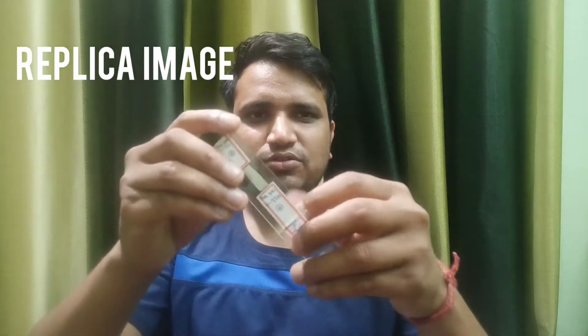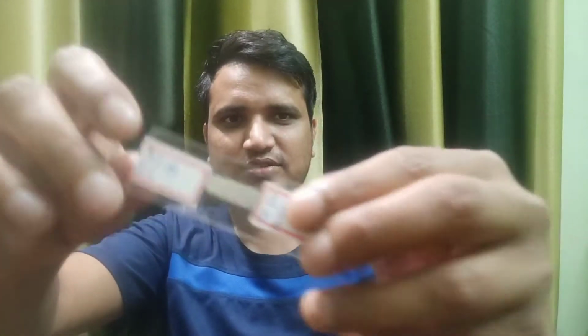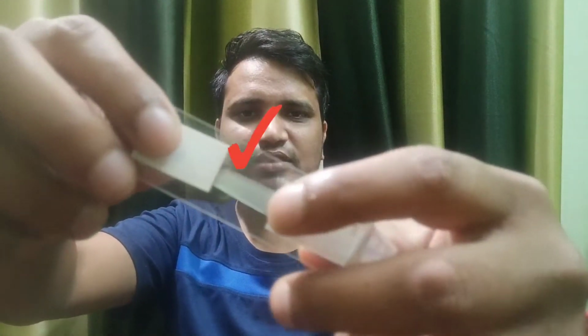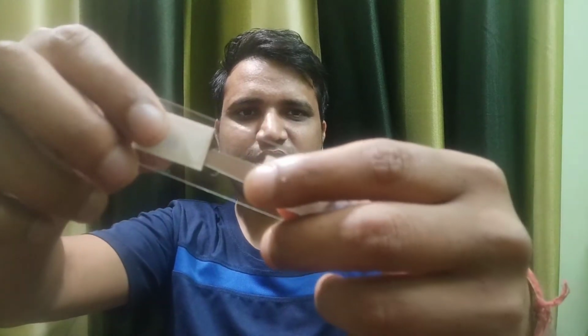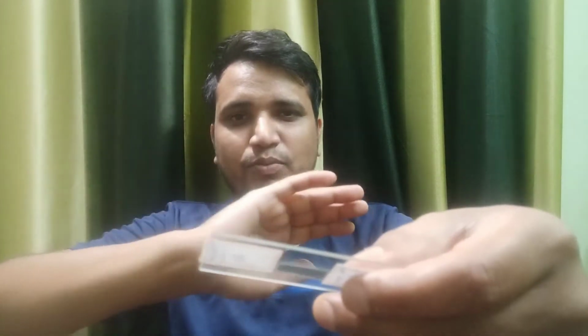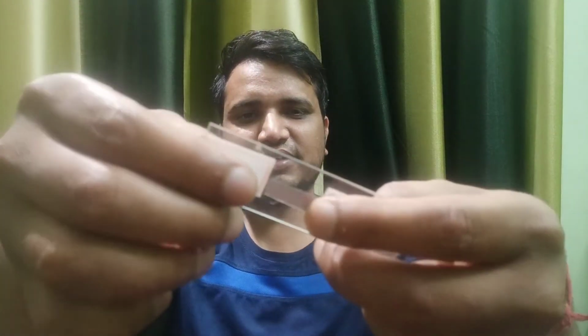So what we do, we polish the surface over there and we take a replica image of that, and that replica image is taken in this. So this is just like a slide. Okay, so this is of glass, and here you can see the white tape. This is one kind of film, which is placed on the properly prepared surface. The region should be etched and very properly prepared. So there we keep this and the image gets imprinted over here.